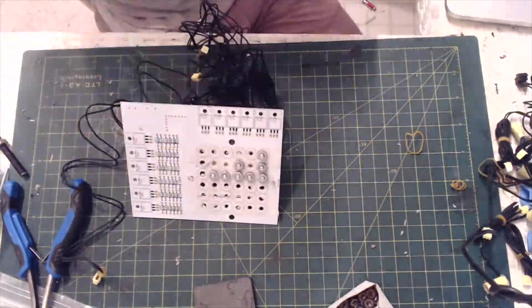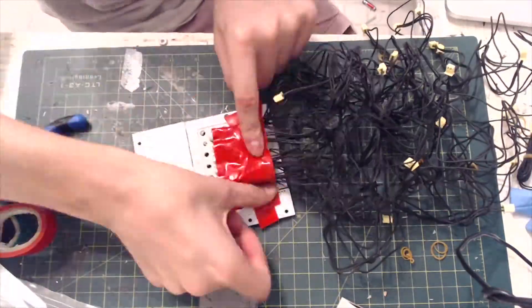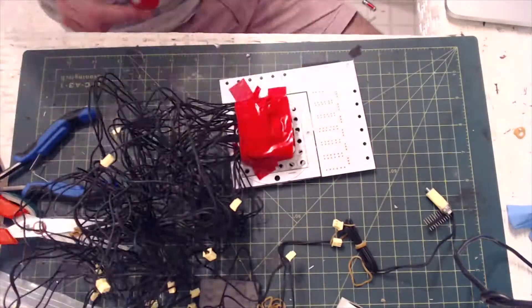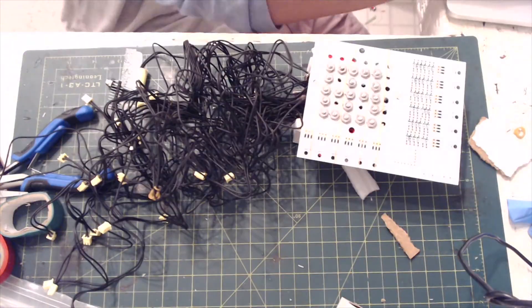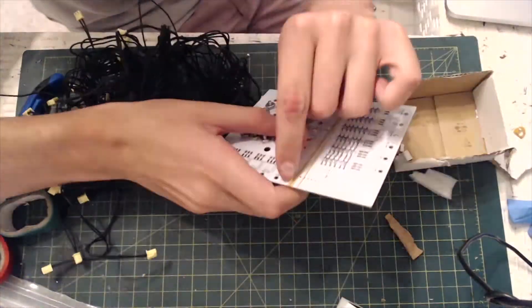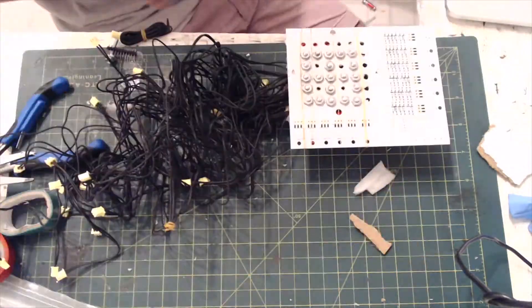For this video, I am reusing boards from my previous ferrobot tutorial, since the spacing for the solenoids was roughly the same as that of the electromagnets. However, I will not be using the rest of the board. I taped up the back since there are so many wires coming out, and attached a permanent magnet in order to cause attraction on the off-state. I also used a cardboard box in order to stabilize the board and ensure a uniform height.